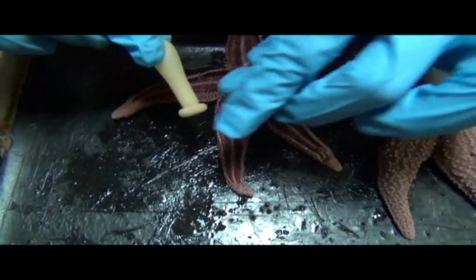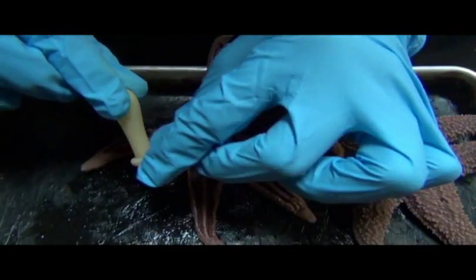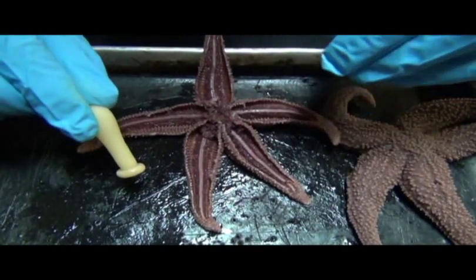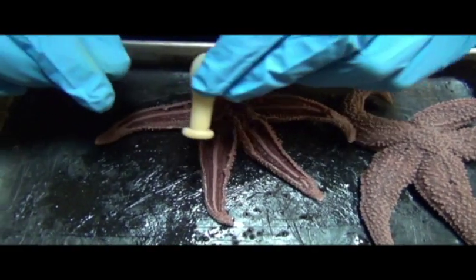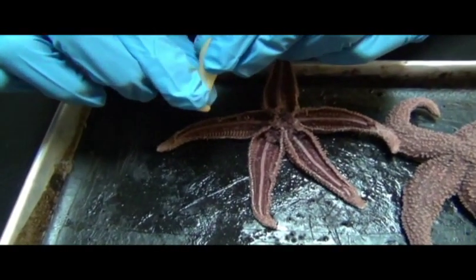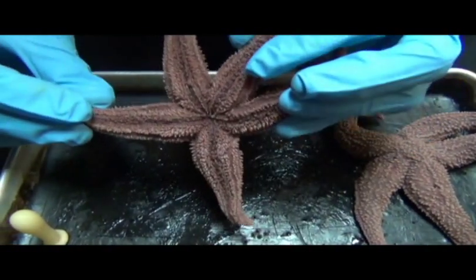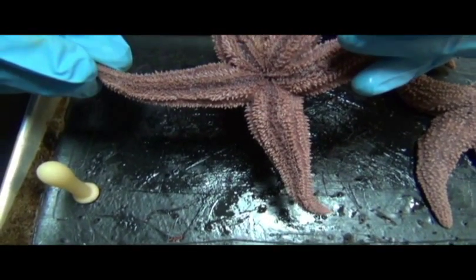Okay, so this is a summary of the tube feet, and whenever you see these guys walking around, all that's really happening is that there's water being controlled coming through this central plumbing system, and if more water gets extended into one of these tube feet, that tube foot will pretty much either extend or retract or become rigid, and so that's how this animal walks on its hundreds of little tube feet on the oral side.